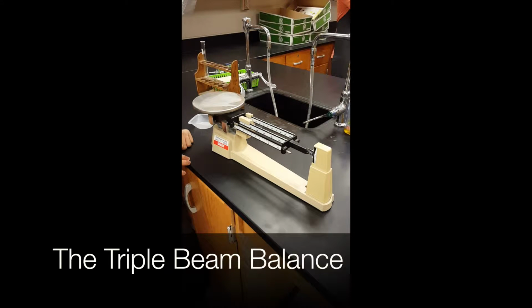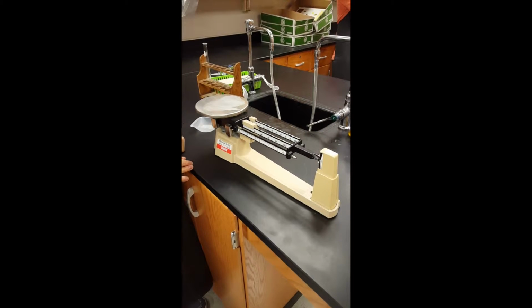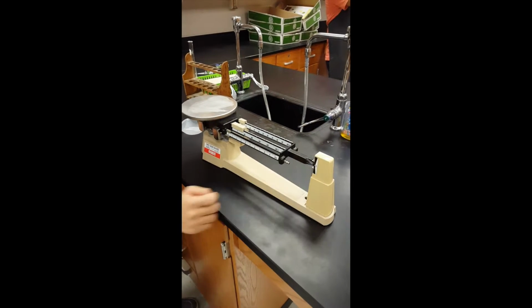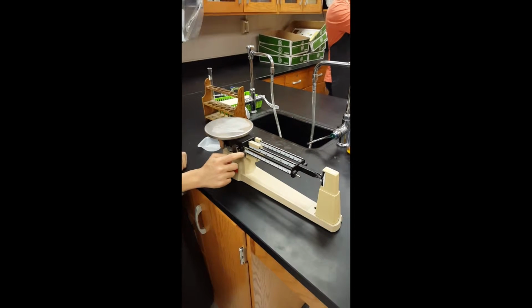This is how you calculate the mass of an object using a triple beam balance. This is where you place your sample. These are the weights you move to balance the weight of the sample. This is the indicator that shows when you are balanced. This is the 100-gram increment, the 10-gram increment, and the 1-gram increment.